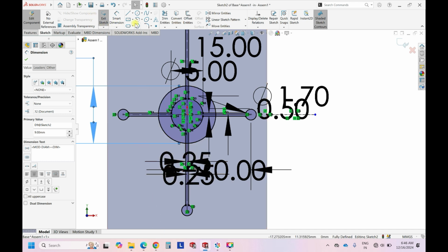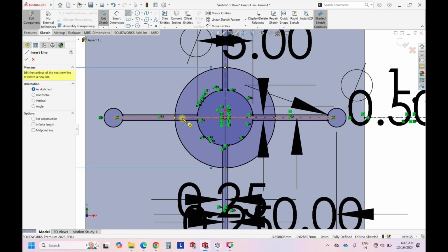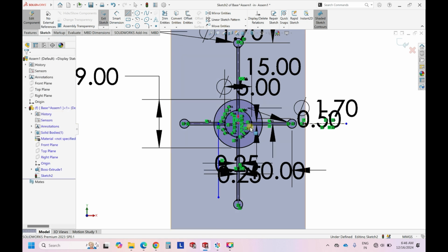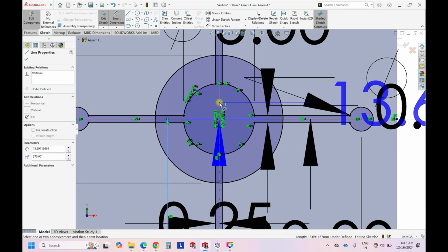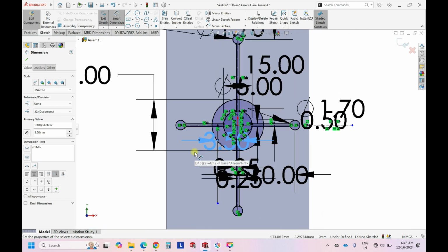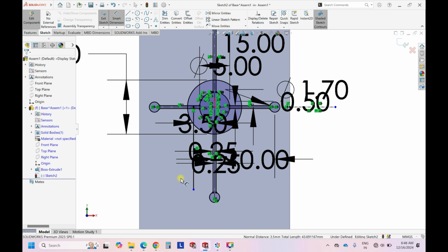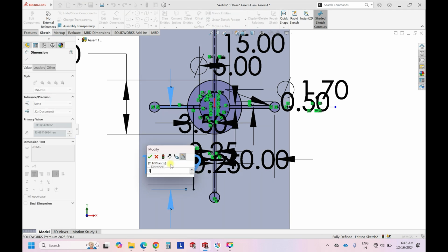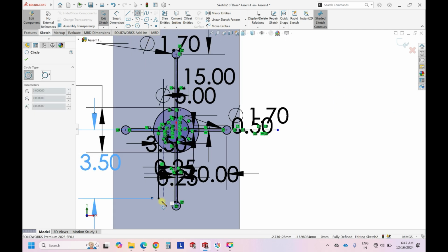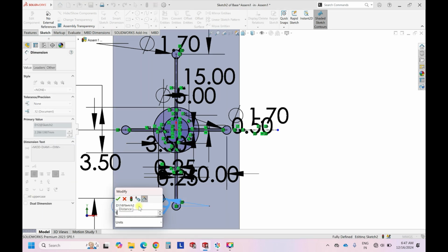Right. So what we can do now, simple thing. For this line, we can choose the distance from this to the center line. Let's say we wanted to keep it as 3.5 mm. Okay, 3.5 mm. And then the channel height. So previous length was 15 mm. So this we can decrease to 13.5. So we are just cutting down 1.5 mm from the previous. Okay, and then to this we can create an inlet. Give the dimension as the same dimension, 1.70.